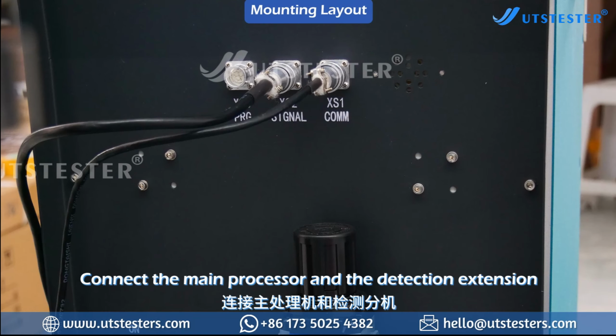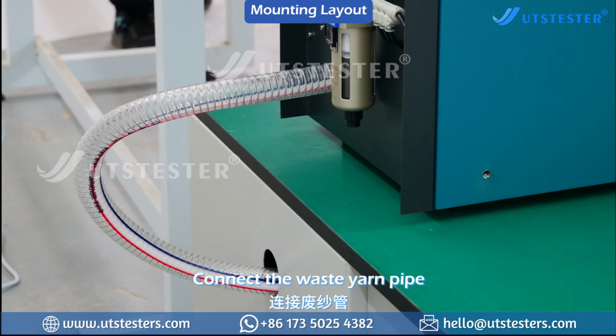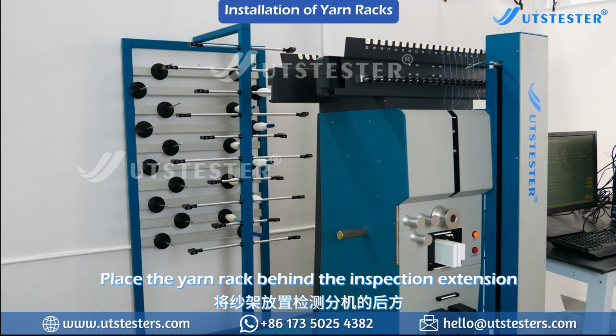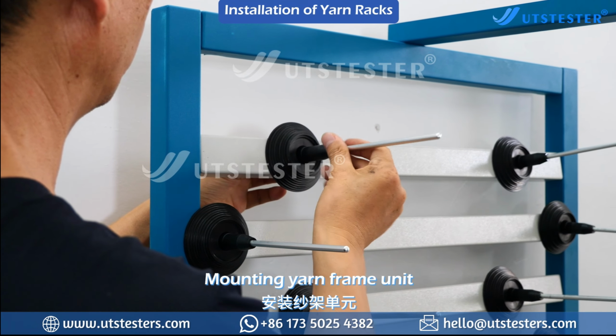Connect the main processor and the detection extension. Connect the printer. Connect the waste yarn pipe. Place the yarn rack behind the inspection extension. Install the tensioner. Mounting yarn frame unit.